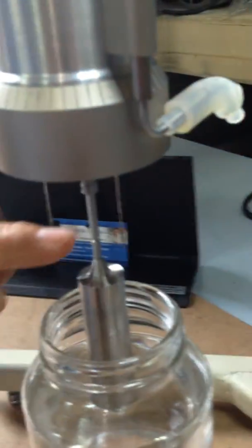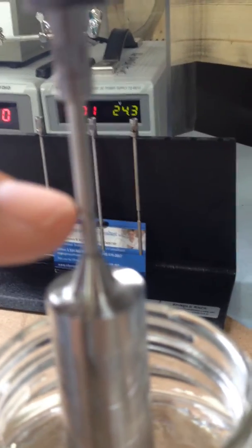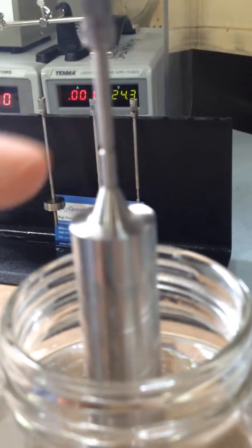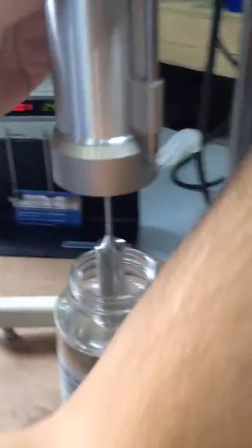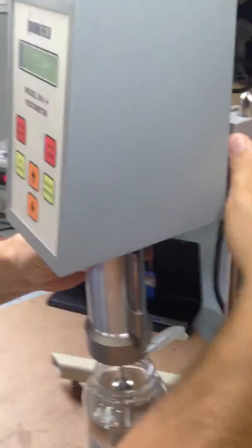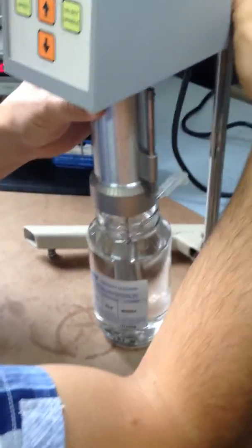You're going to take the lower level and you're going to make sure that your level is actually up to here. When you're going to lower it, your liquid is going to be up to here, that's the mark. We're going to take the lowering, the viscometer into it.